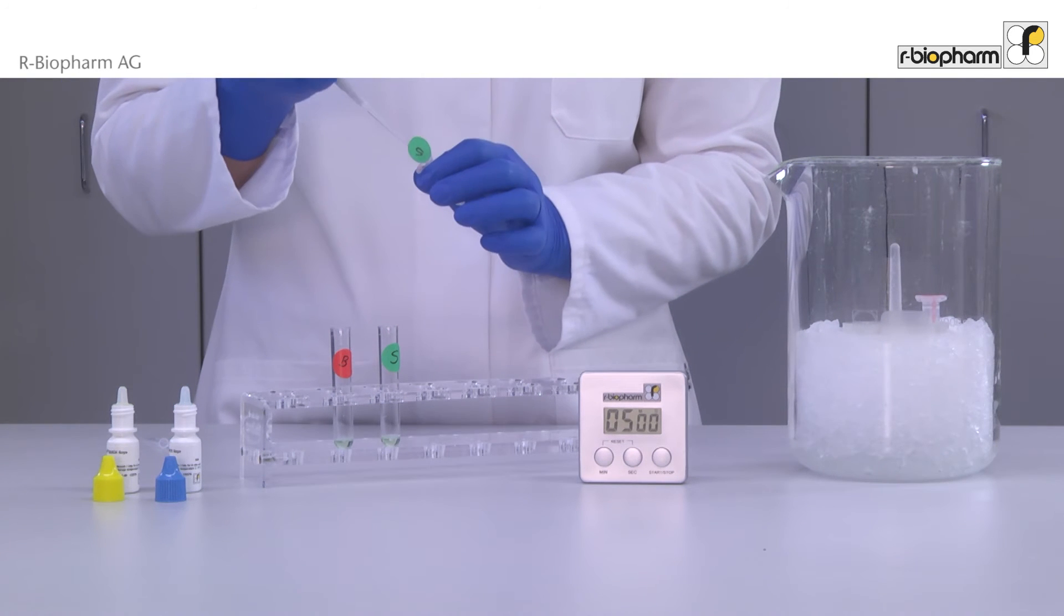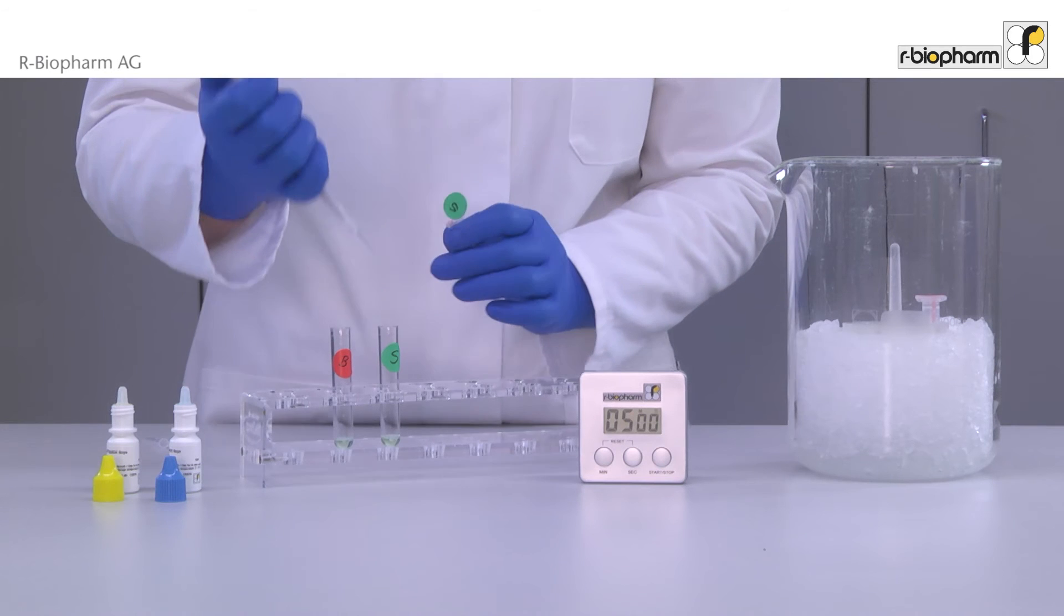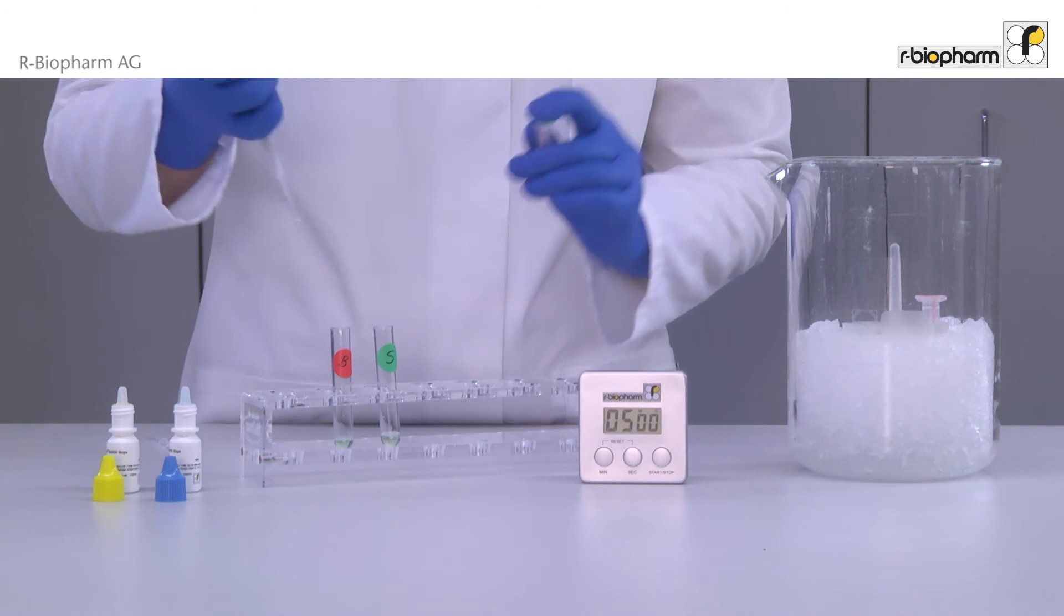Next, 150 microliters of the swab samples are pipetted to the five milliliter tubes and incubated for five minutes.